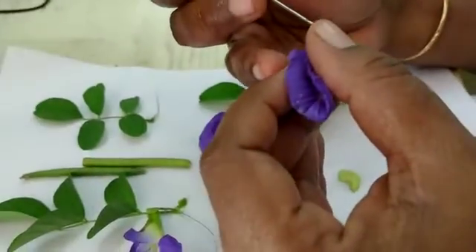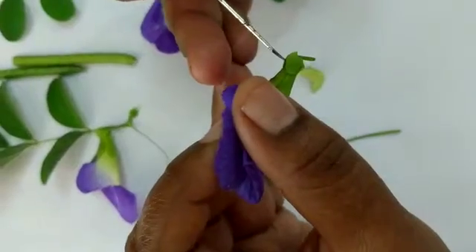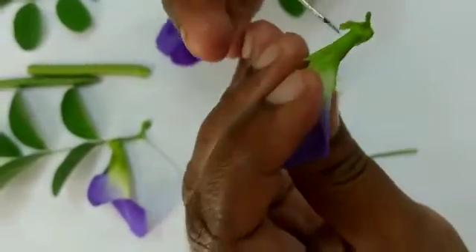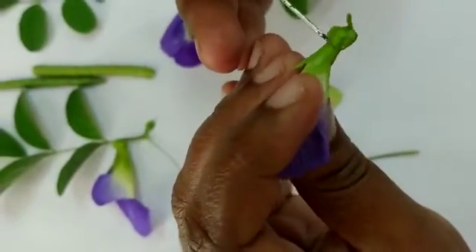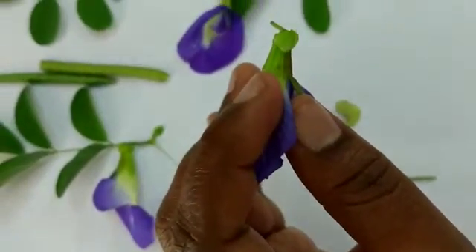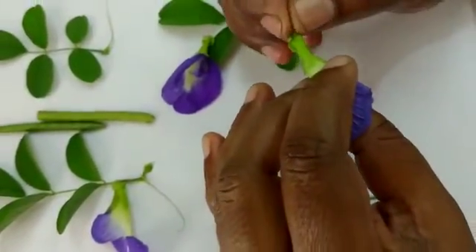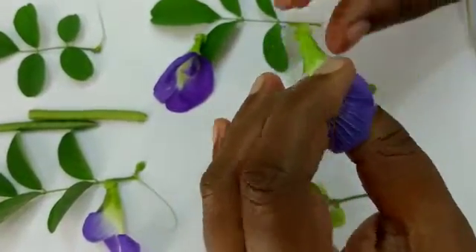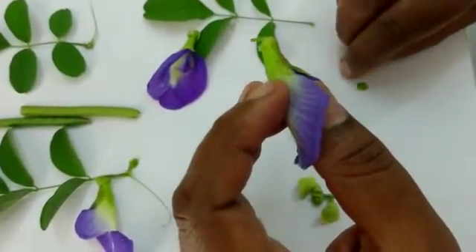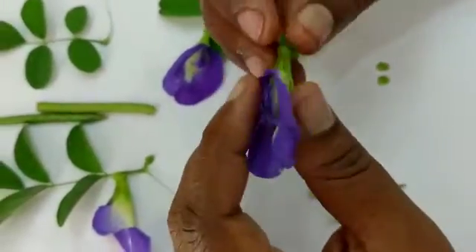It has a bract, so it is a bractate flower. You can see the bract here — one bract here and another bract here, so two bracts are present. We call it a bractate flower. I am removing the bracts like this.